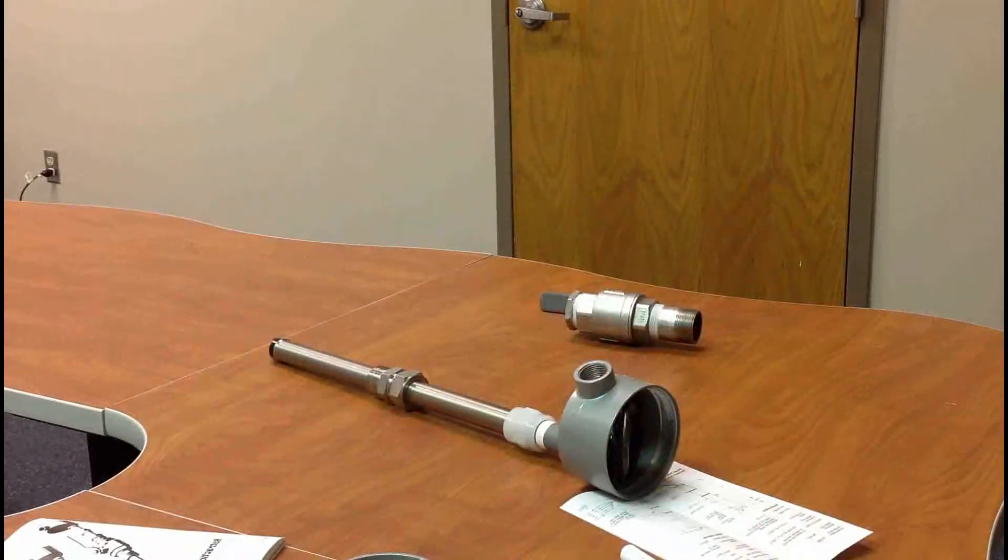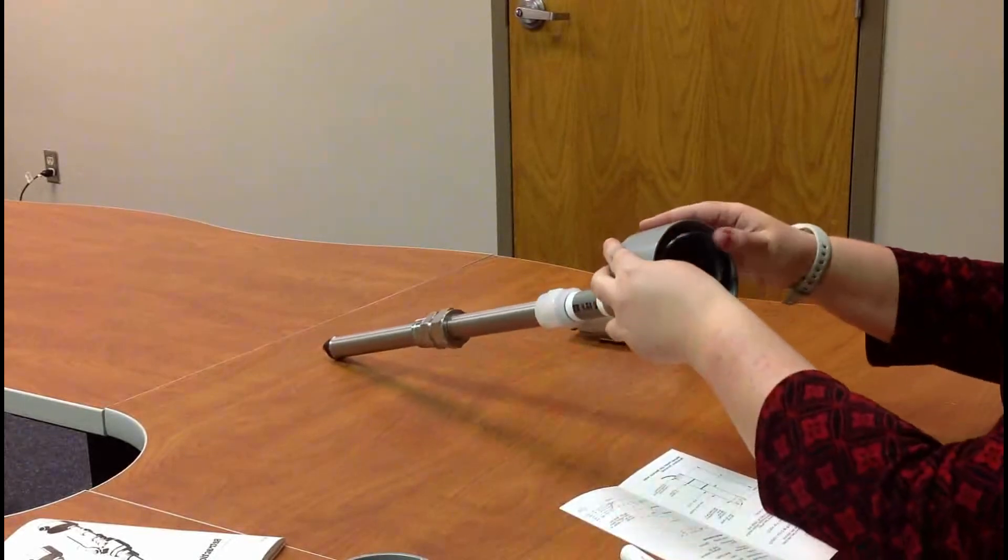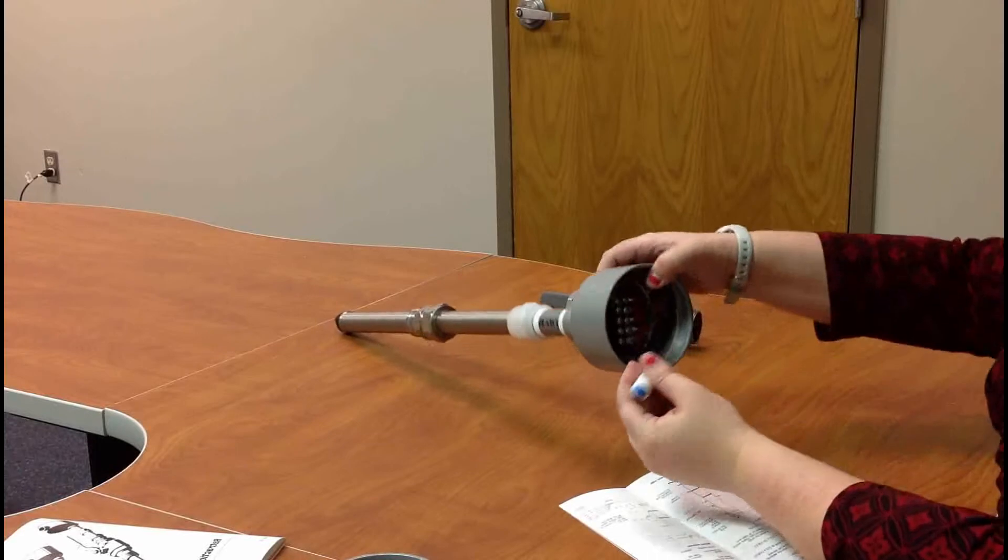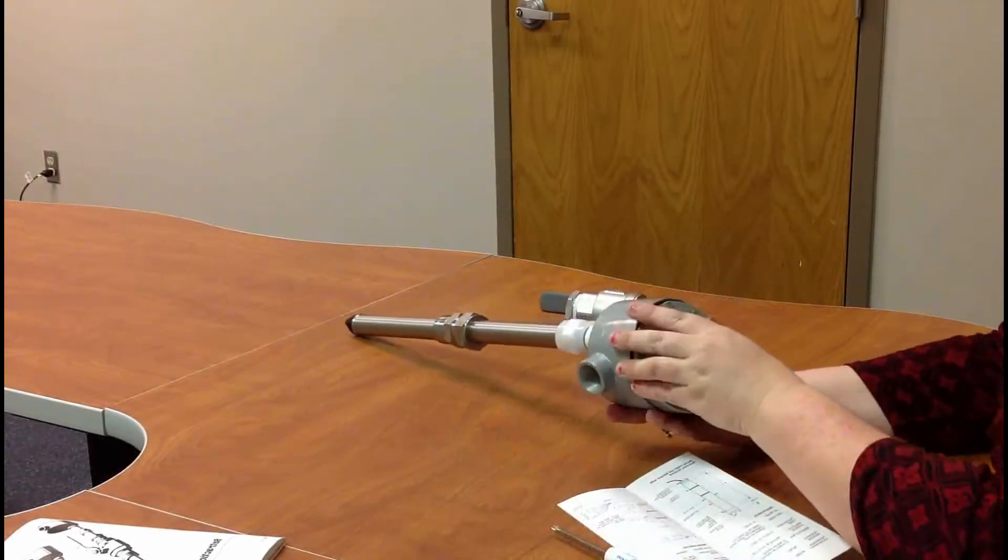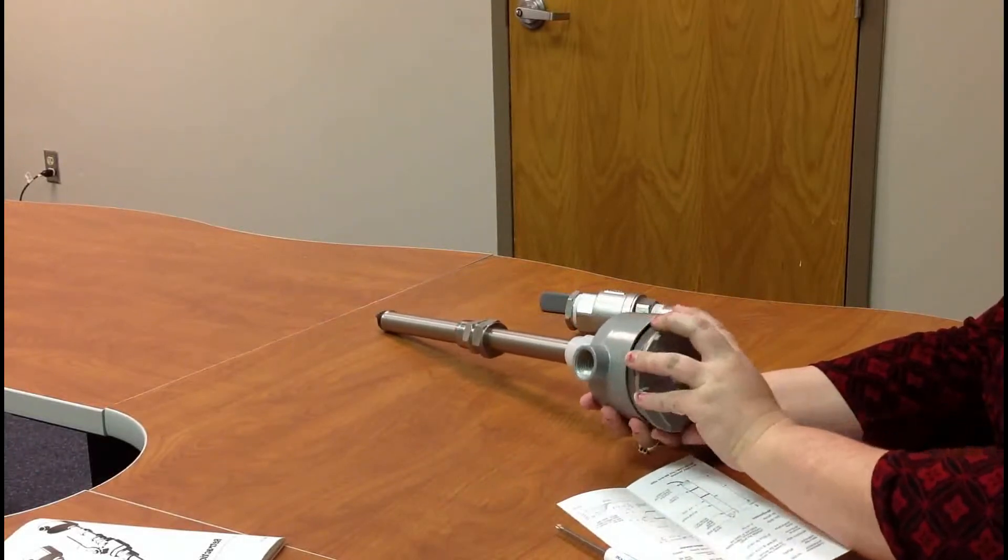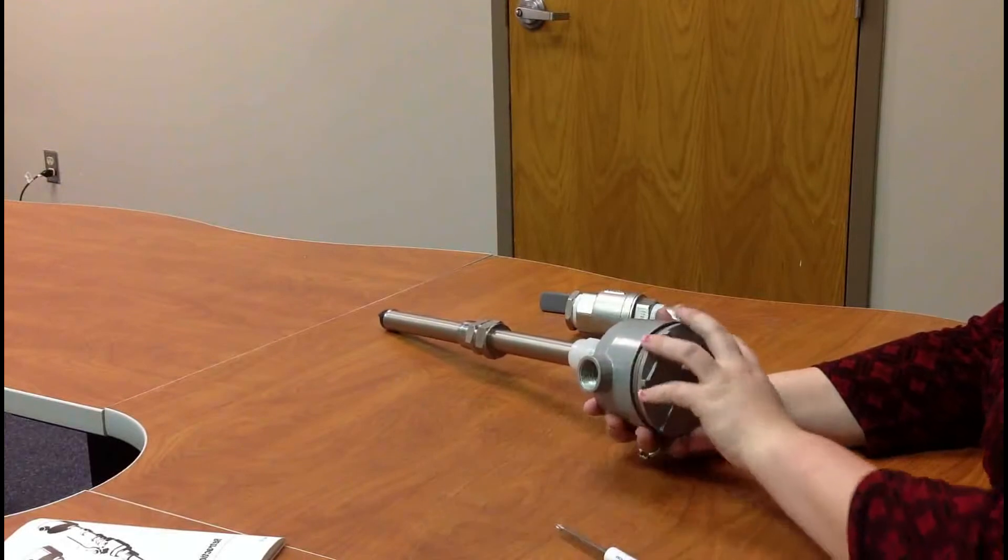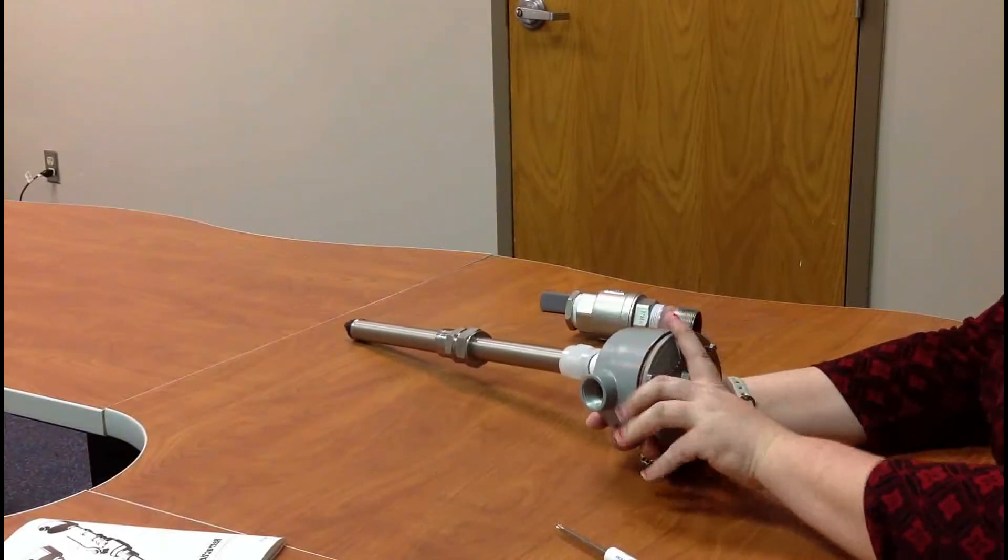Okay, so once you've actually wired it correctly, what I'm not showing in here is the extension cable that would run from this side of the terminal strip outside the sidearm into your transmitter. So then you just match it up point to point from there on what those pins mean. Measure, reference, temperature to what they are on your J-Box, I mean, in your transmitter.